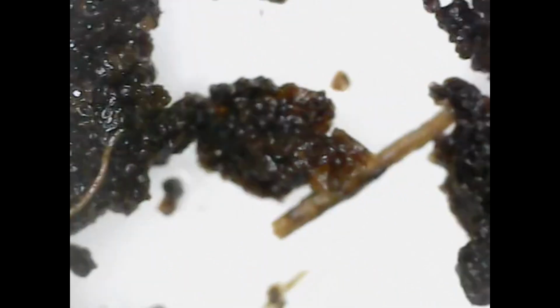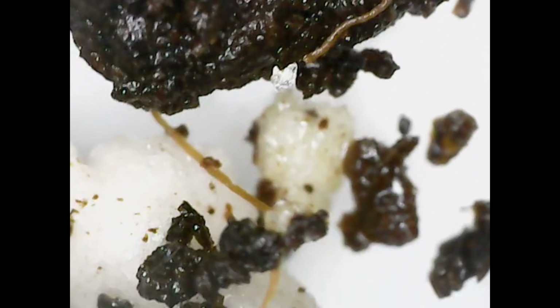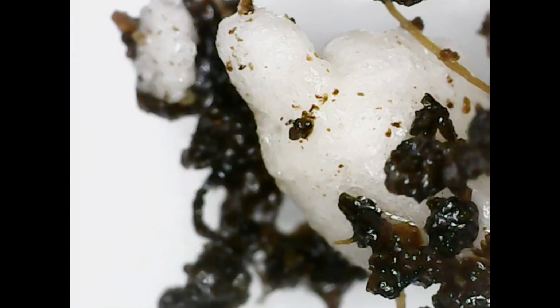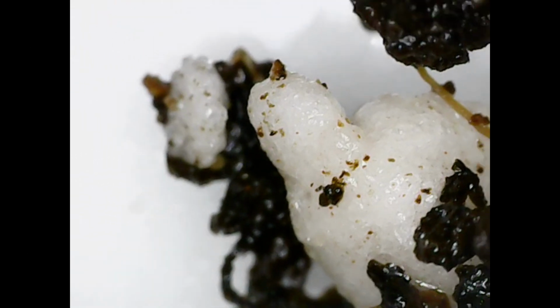We're now going to be seeing the wet mix, and you can see the difference here, how much moisture that coco coir has absorbed. You can still see those fibers of the coconut husk. You can see the perlite there that's also saturated. There's probably still some of that charcoal in there as well, but it's kind of mixed up with everything.